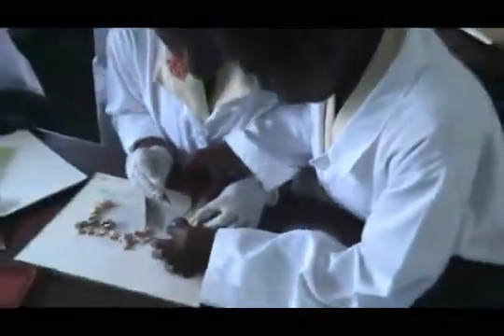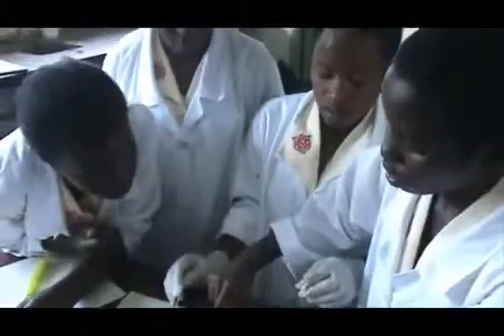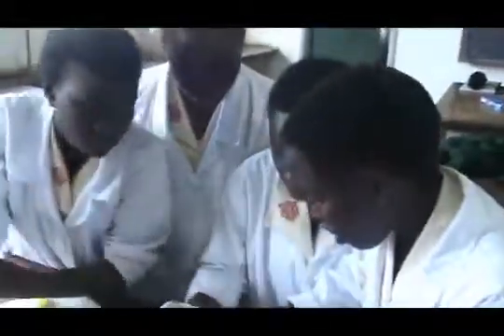Due to its toughness, it takes time to cut. Using forceps, hold the cornea and continue cutting. The forceps enable easy handling during the cutting. Eventually, using the forceps, remove the cornea from the eye.